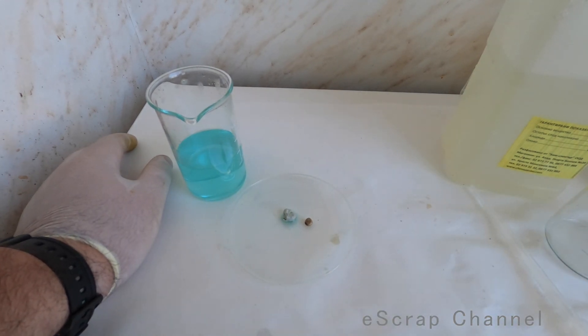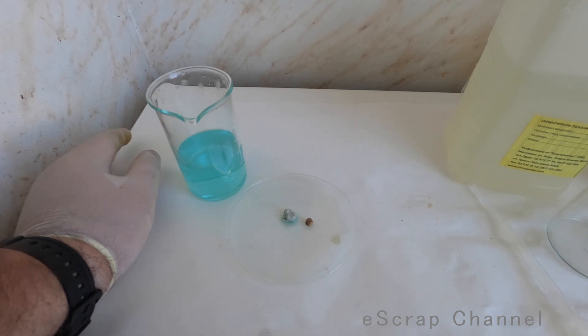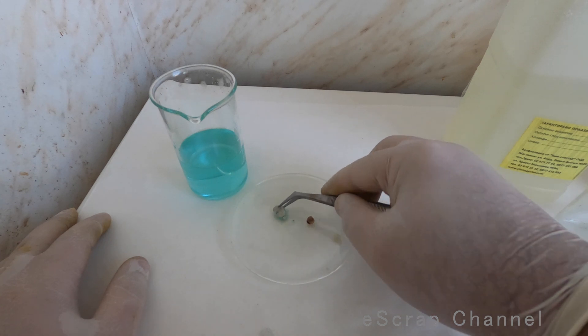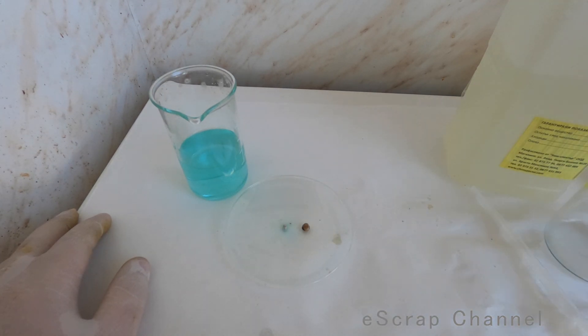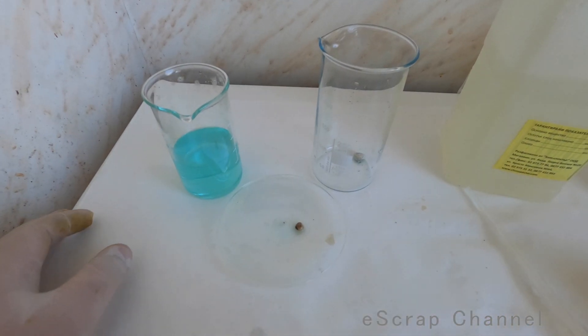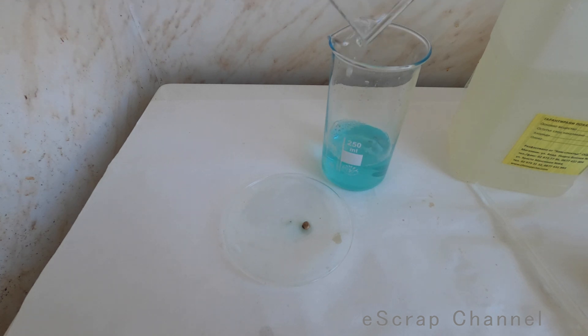So how should we continue? Let's dissolve the silver in nitric acid. So I will return the silver here and continue the reaction to see if all this will dissolve or not.